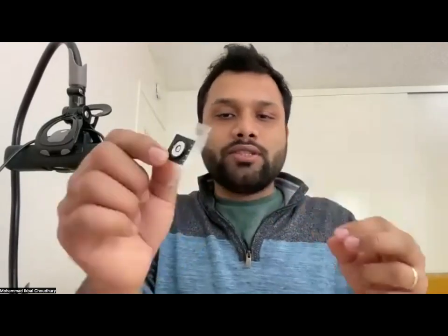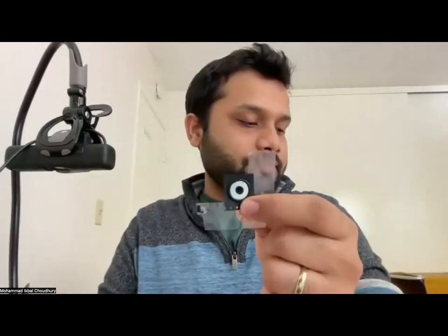Before we attach the phone to the foldscope, we will check the accessories that you received with the foldscope kit. One of the accessories, there must be one, is this magnetic connector. I have it attached to a bunch of tapes here, but they are not necessary right now. You can try looking for this connector, and once you have that, can you give me a confirmation so that I can move on to the next steps?